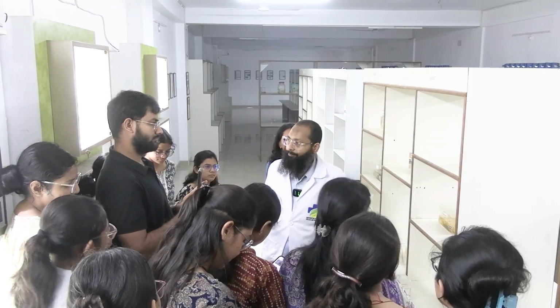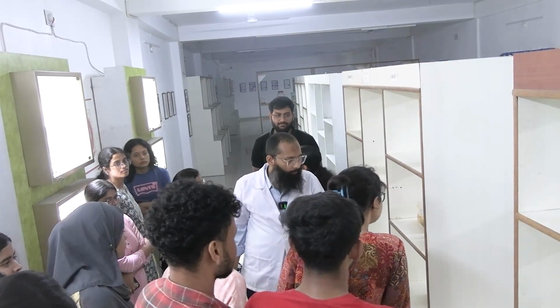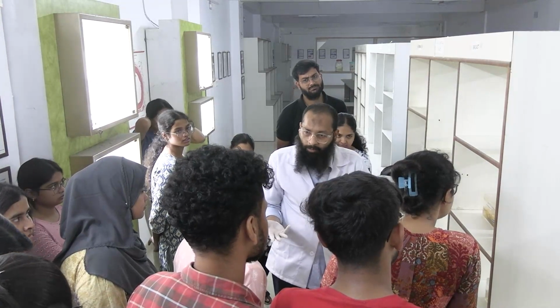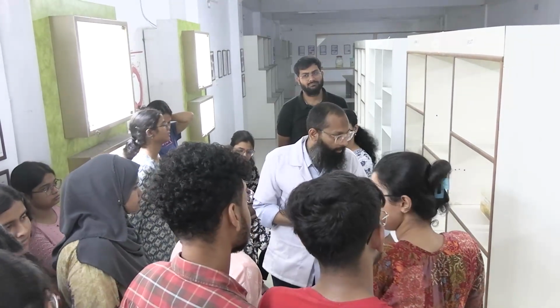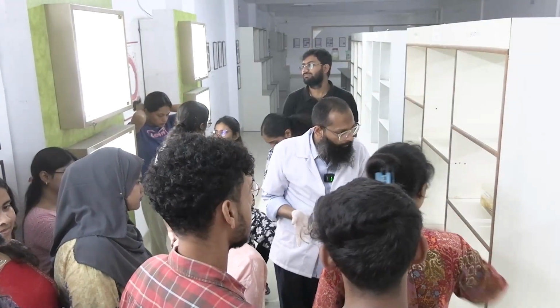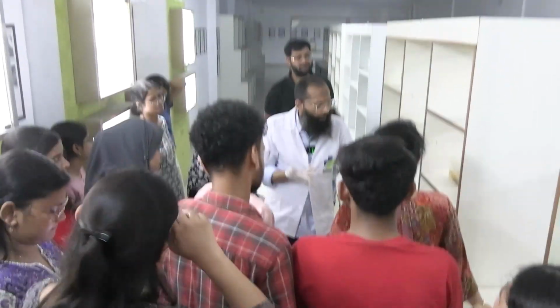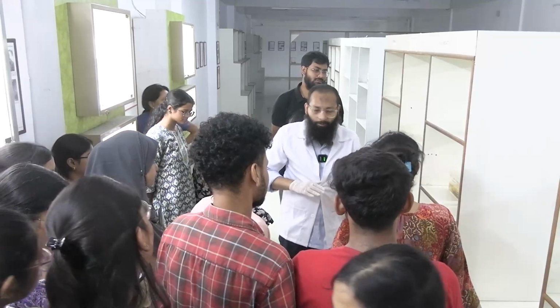Okay, clear? Bottled, mounted. Okay, very good. Ill-defined margins, you can say. Okay, that is also going in favor of carcinoma breast. Okay, any other thing? Color, you can say. You can describe the size, approximate. What do you think, what could be the approximate size? You just give an approximate dimension. If not possible then you can also leave if you can't guess.